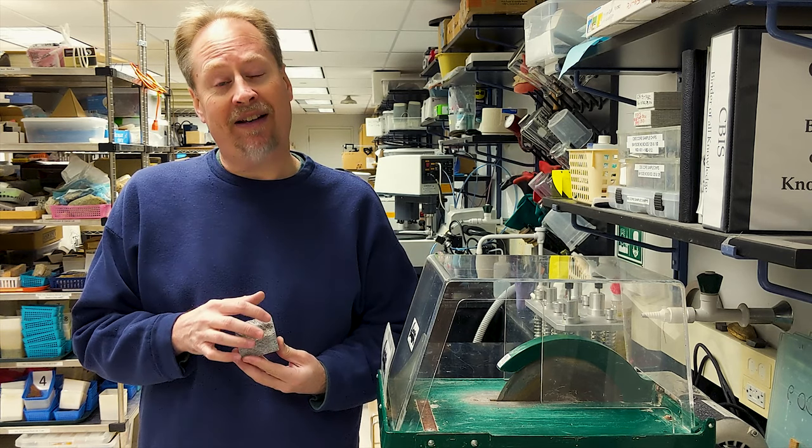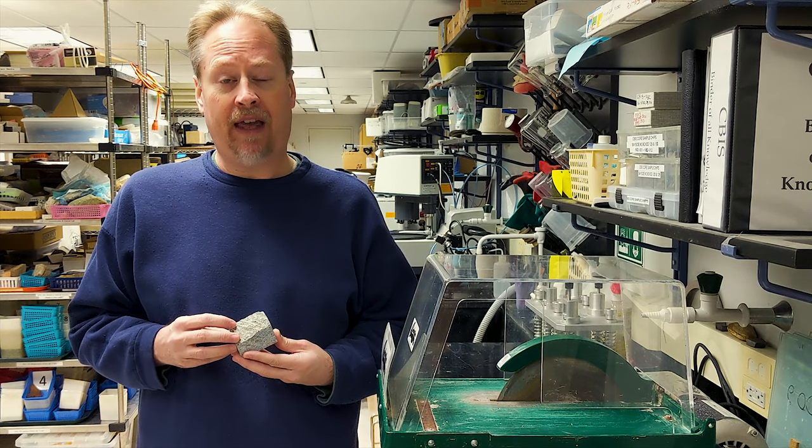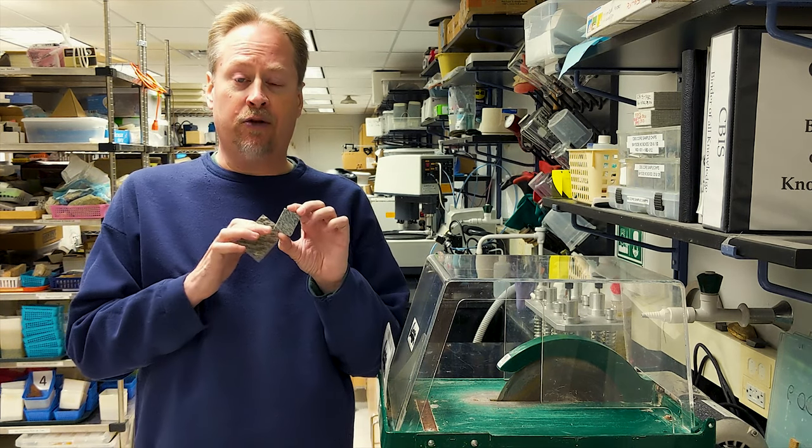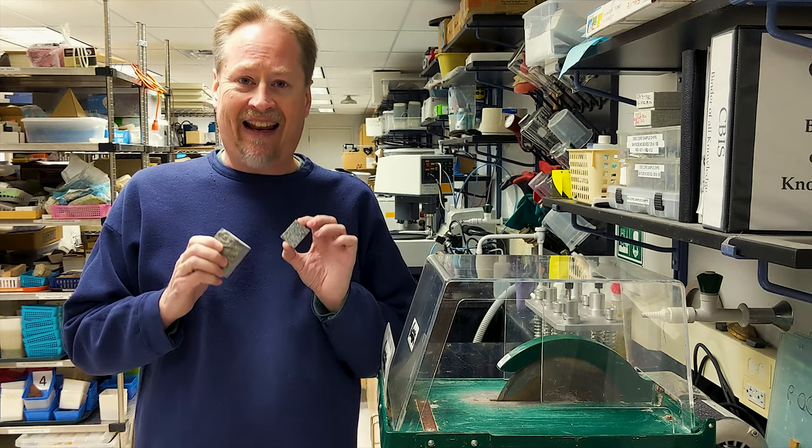During the cutting process, we may also identify unique features on our sample that we want to highlight or focus on in our thin section, so again, we'll use the rock saw to trim a chip that focuses in on that area of interest.